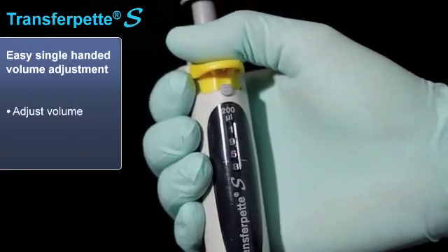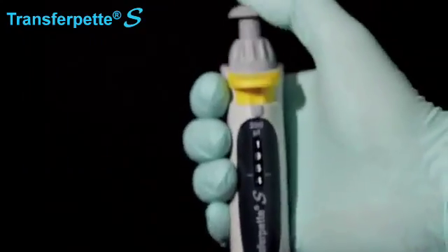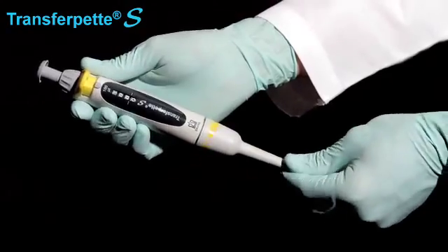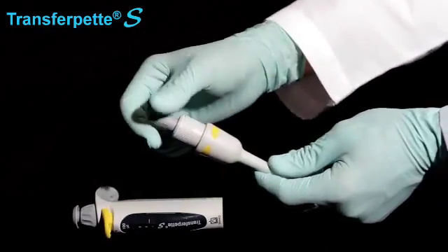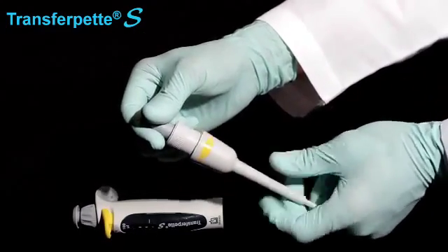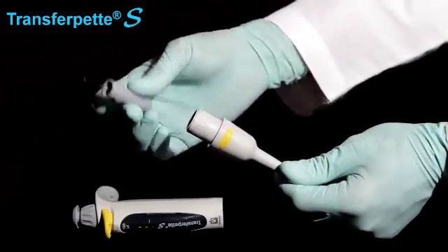Reset the brake and pipette. Maintenance has never been easier. No tools are required to disassemble the instrument for cleaning and servicing, and parts and components are available for simple maintenance issues, all of which can be performed by the end user.